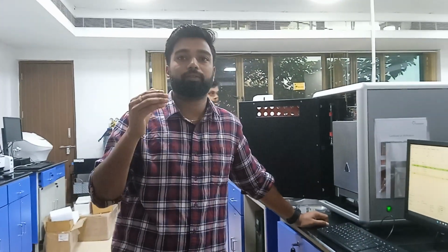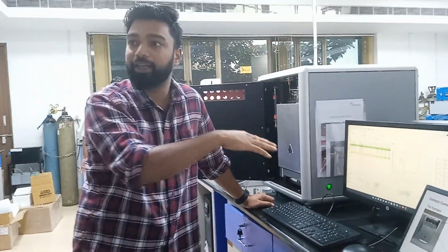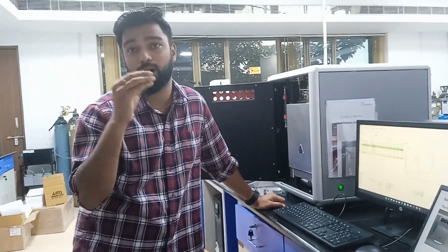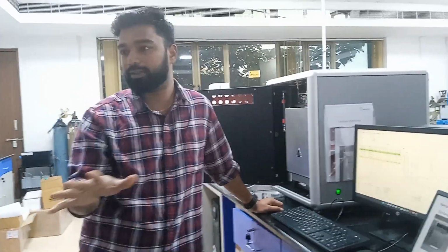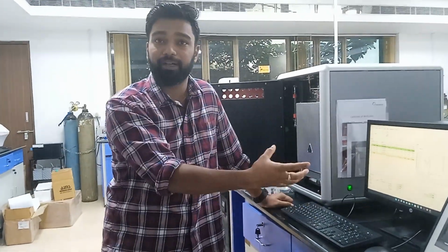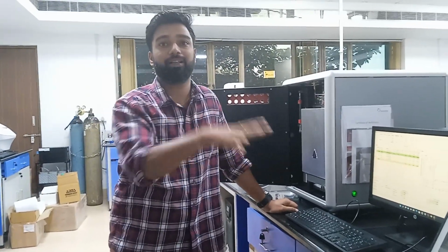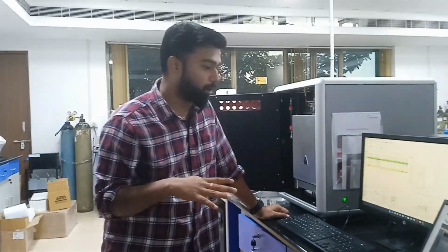For that, this standard is not suitable. So you can add a separate standard. That standard is called biphenyl or diphenyl. It has a carbon percentage of 92% something, exactly I don't know, it's above 90. To get a better result, you can use that standard and calibrate the instrument according to it. It will work fine like that. Now it is calibrated with sulfonamide. So coming to this.